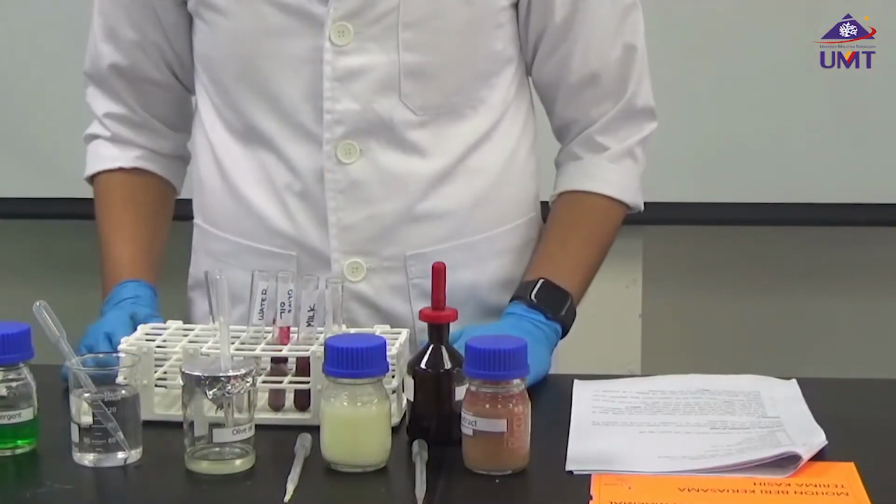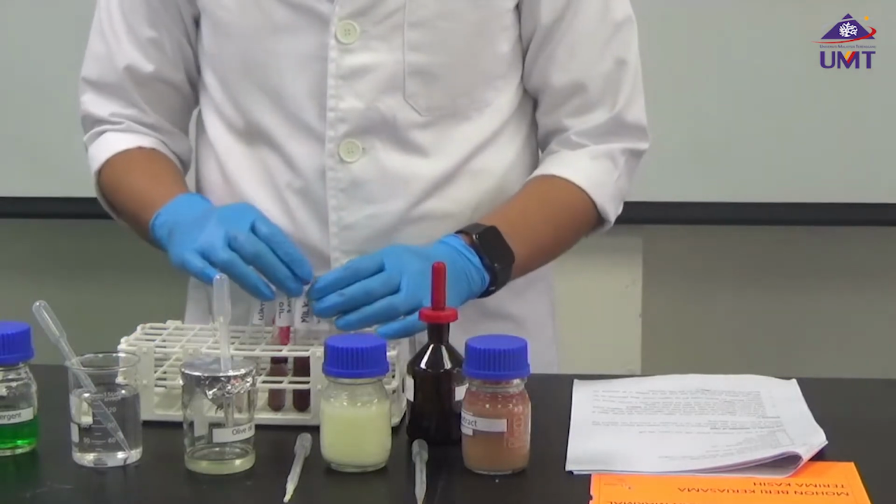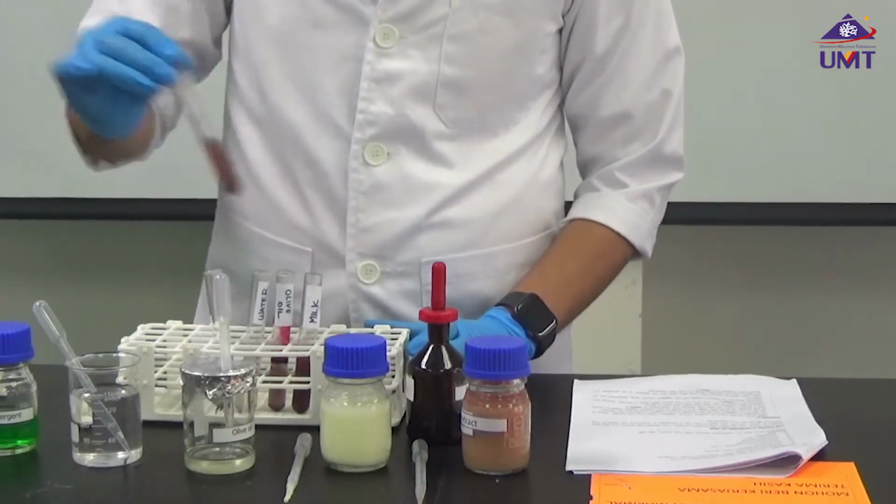Okay, 5 minutes has passed. Now what we're going to do is shake this again, gently.